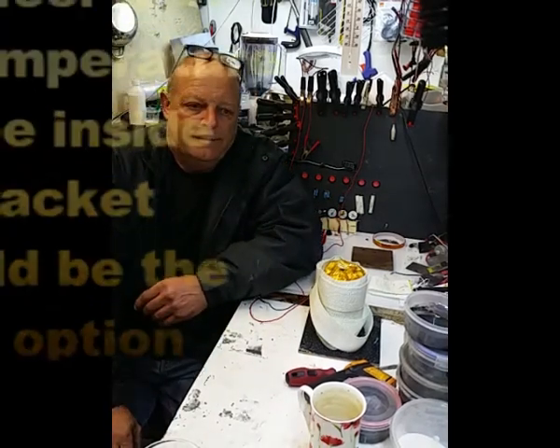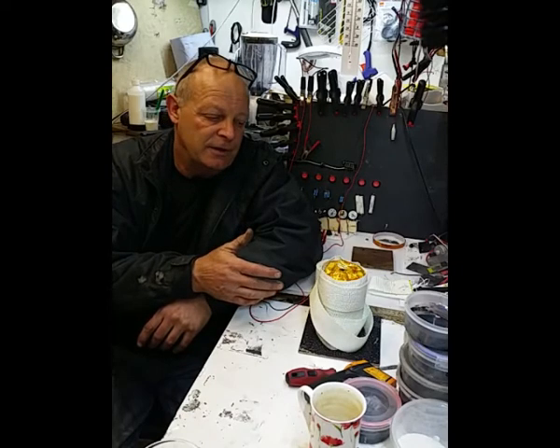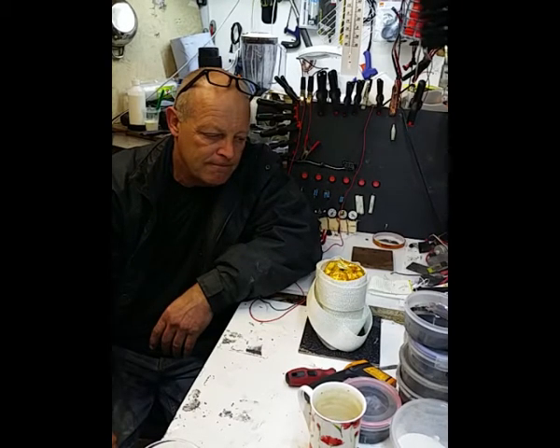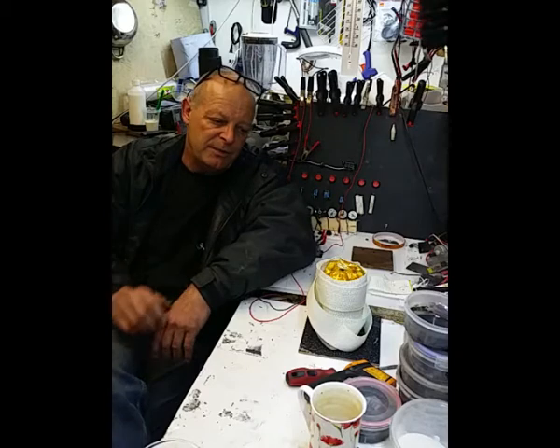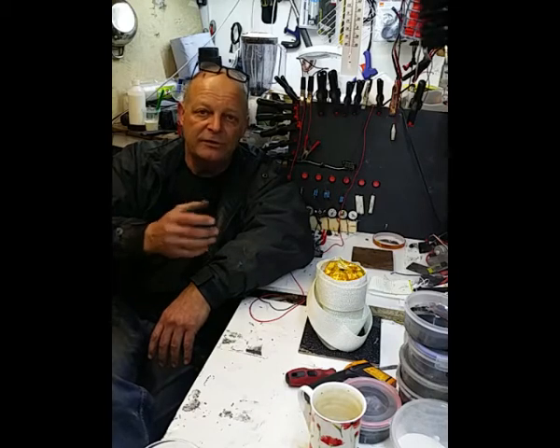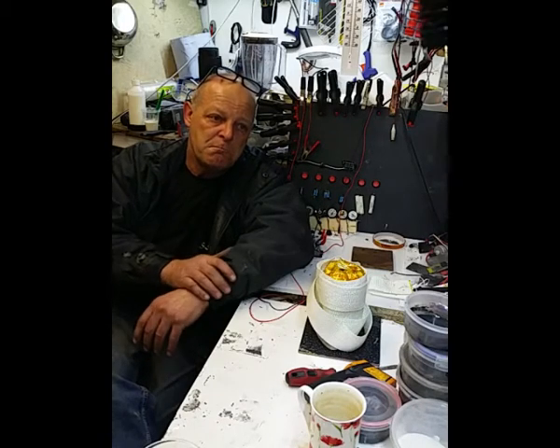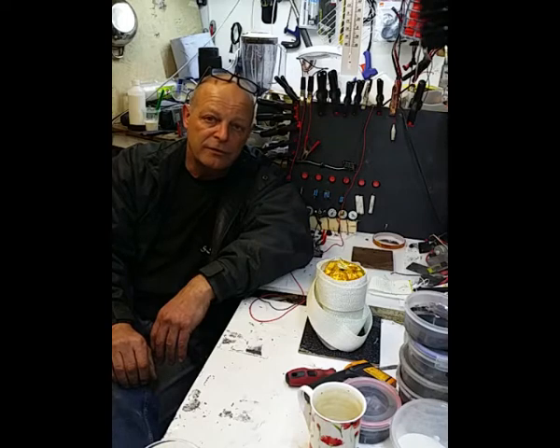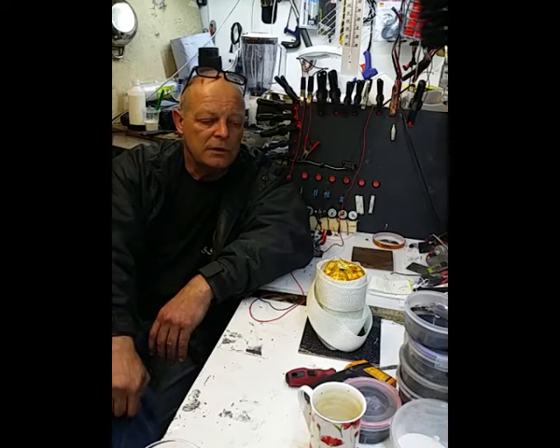So I guess as a concept it's worked. Certainly got somewhere near the temperature that we need. I think the jacket could be better, and I think with the extra insulation we've got up to the temperature, so conceptually the idea is there, and all I can do is improve on it. I think the idea of that material that they line ovens with, or kilns I should say, is the way forward, and try it again.